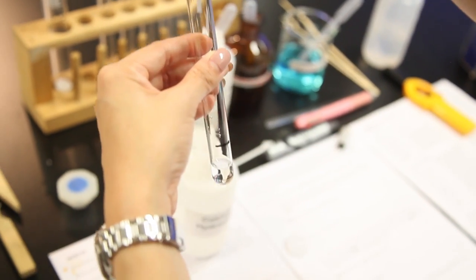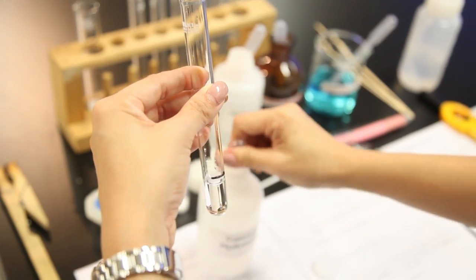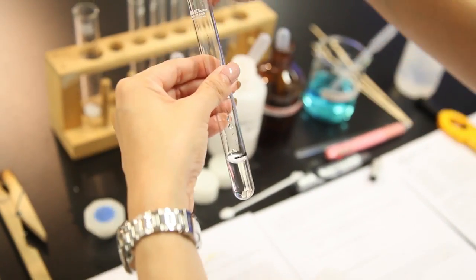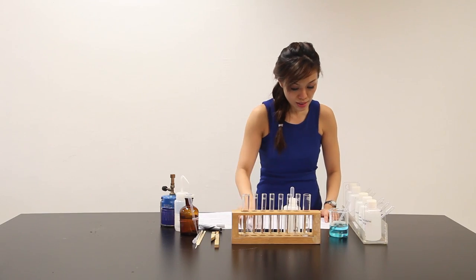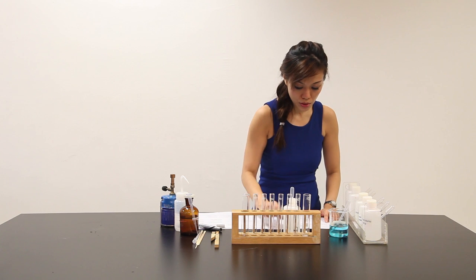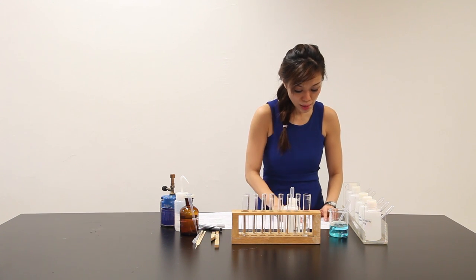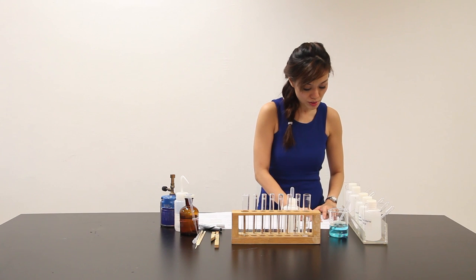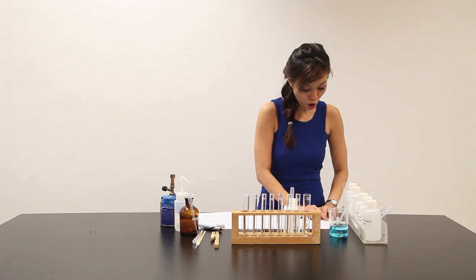Calcium hydroxide. During the heating process, withdraw several samples of gas from inside this test tube. So using a teat pipette and each time bubble the gas from the teat pipette through the lime water. Record your observation and let's go on.